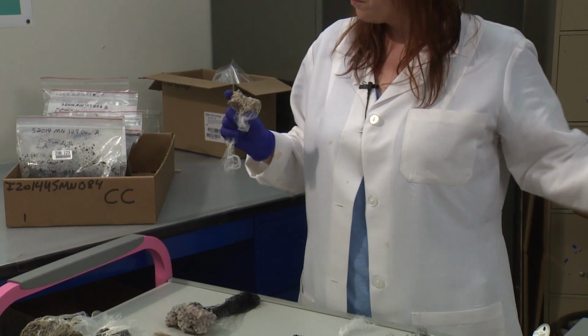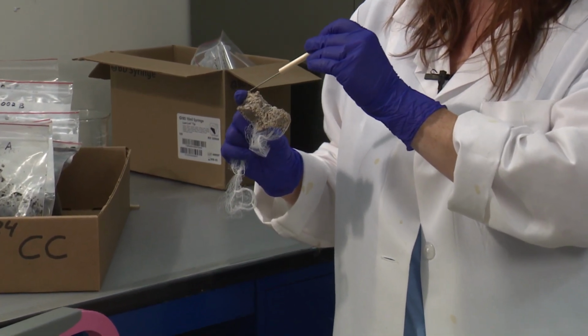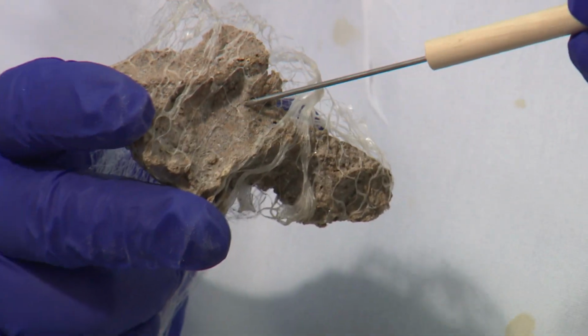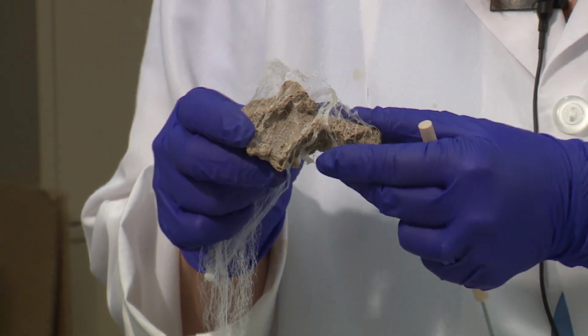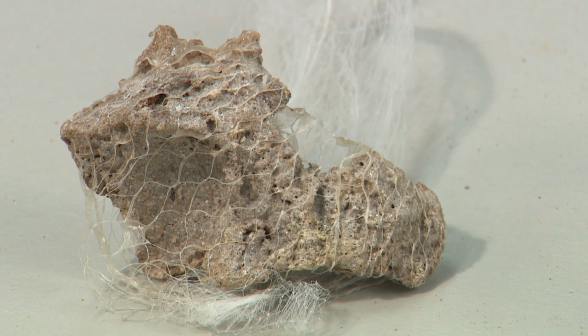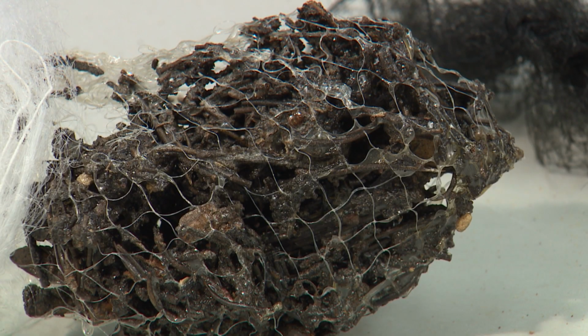Here's another example of a clod that we've gotten here in the lab, and you can see that there may be some tool marks in it, these flat surfaces in here, and that could lead to compaction for these clods and give us abnormal bulk density results. Also, this clod is too small, and it has these thin areas and these peaks that we don't like to see.